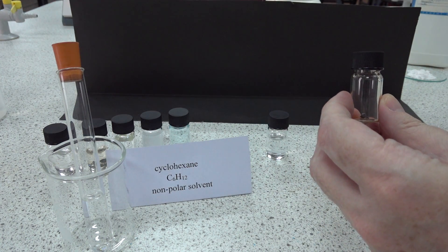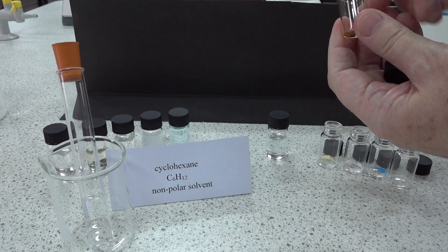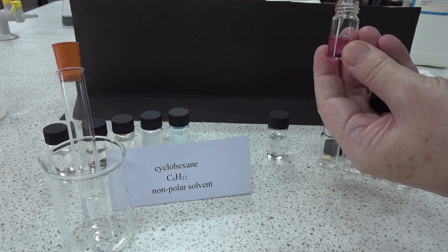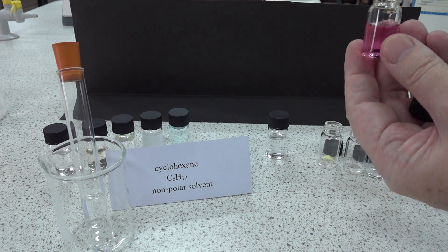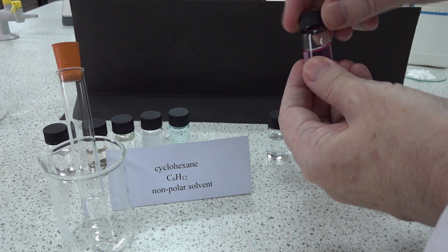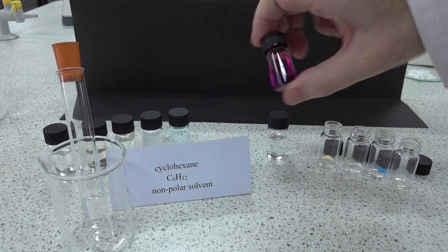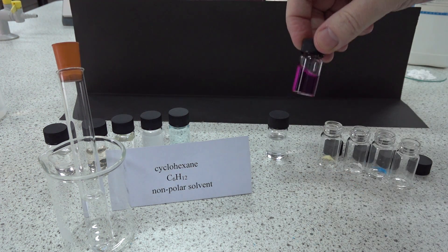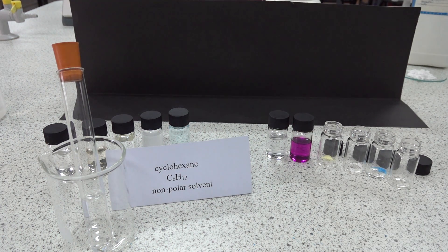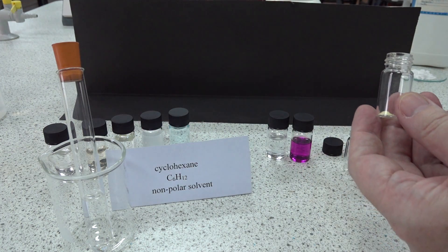What about our second one, iodine - the molecular material? Here's the cyclohexane going in. You may be able to detect already that the cyclohexane has turned pinky purple. That's clear evidence from the color of the iodine that the molecular solid is dissolving in cyclohexane.